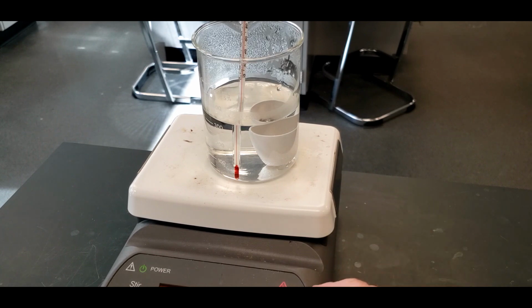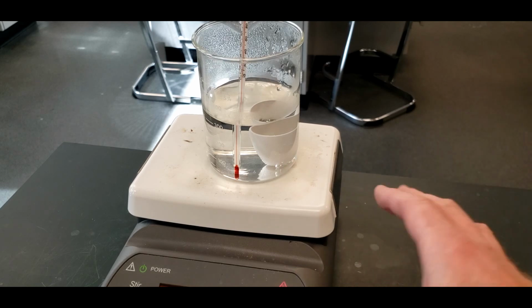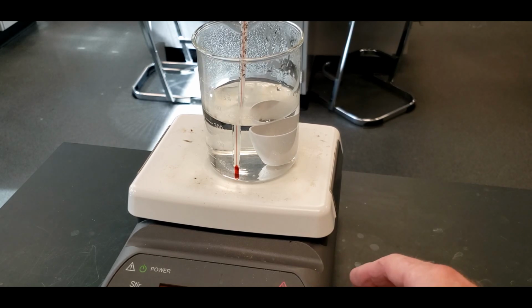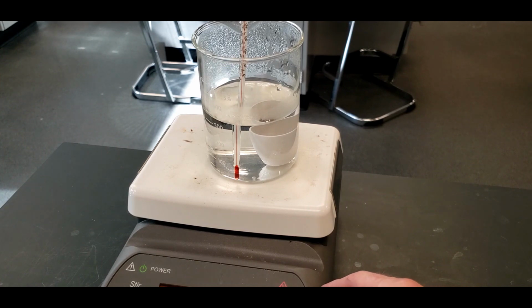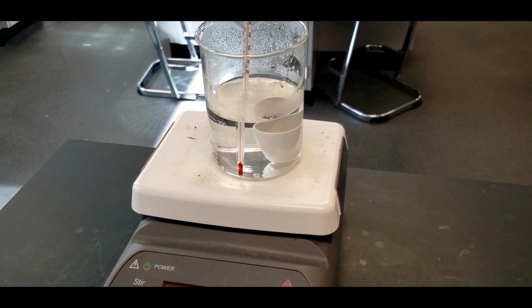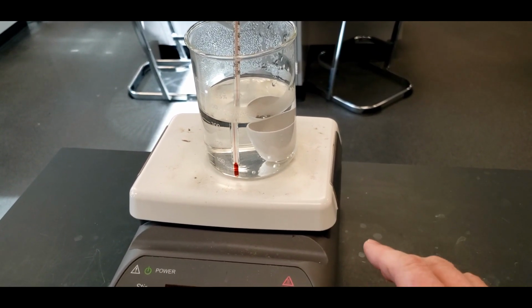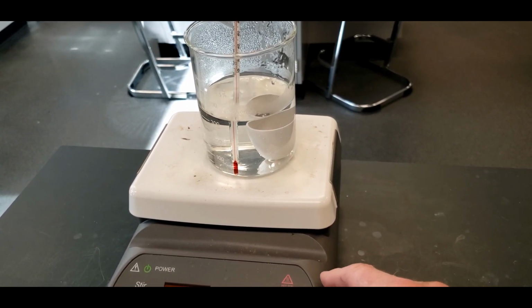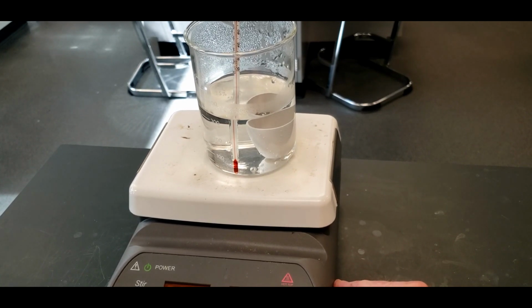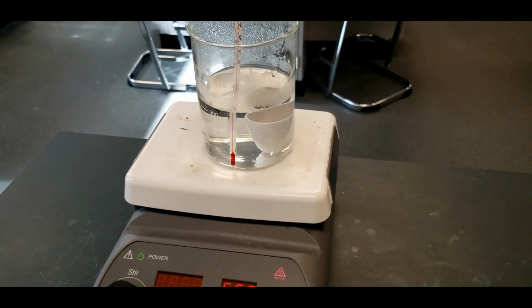One thing I should mention, I moved this around, and hot plates are hot. And it's good to remember that. Sometimes if there's nothing boiling on it, you forget that it's on and it's sitting there. It's really hot. And I knew that, but when somebody knocked on the door, I looked up and I caught the edge of my thumb on this just for a moment. Didn't blister, but man, yes, hot plates are hot. So always be aware of that. If you've got a hot plate going throughout an experiment, very often you can have your elbow touch it or your hand as you're moving around, so just be careful, unlike me. Okay, so we'll let that heat up.